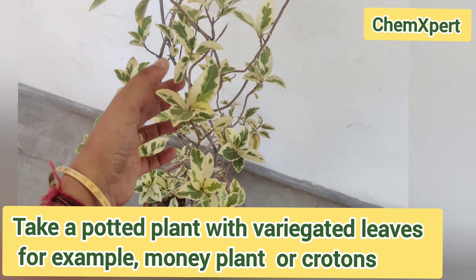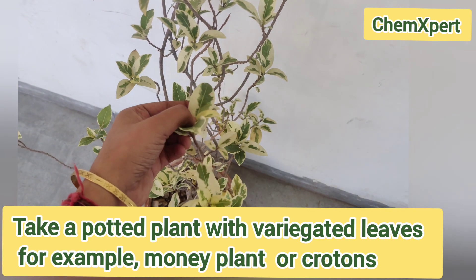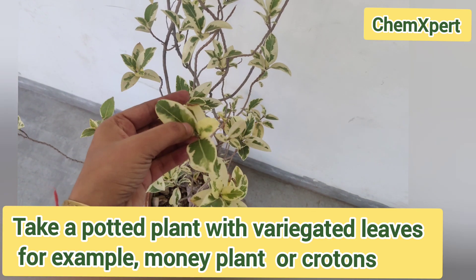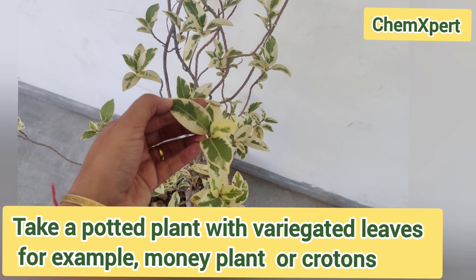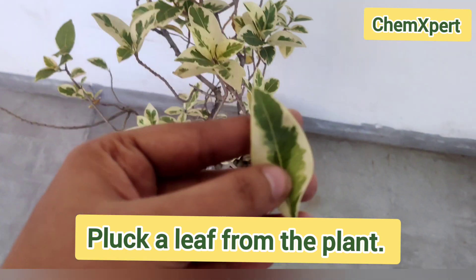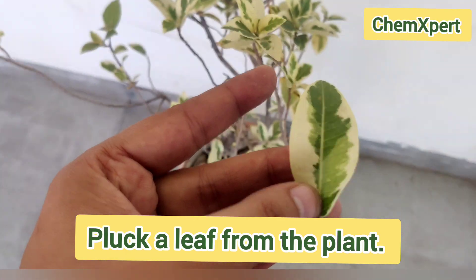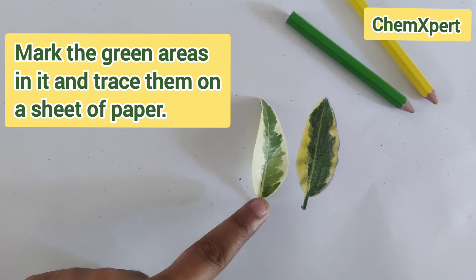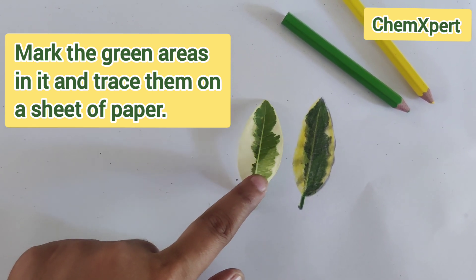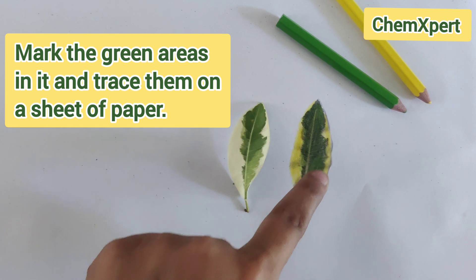The first step is to take a potted plant with variegated leaves. I have taken the croton plant here. Next, pluck a leaf from the plant, mark the green areas in it, and trace them on a sheet of paper. I have traced it here.